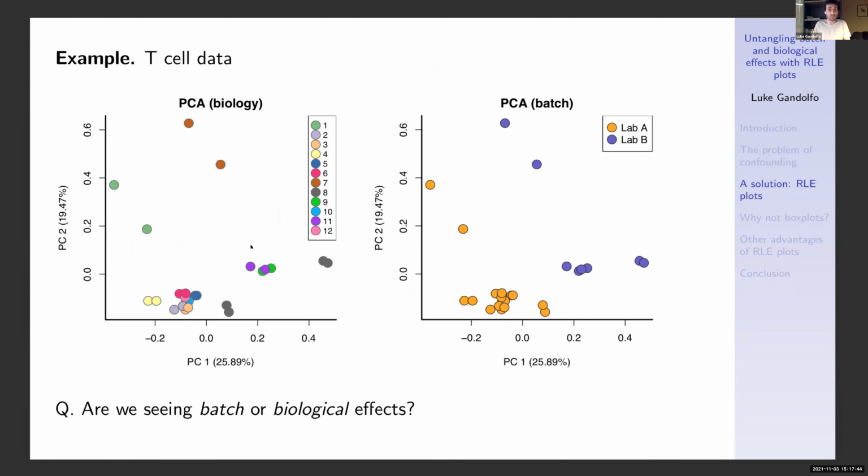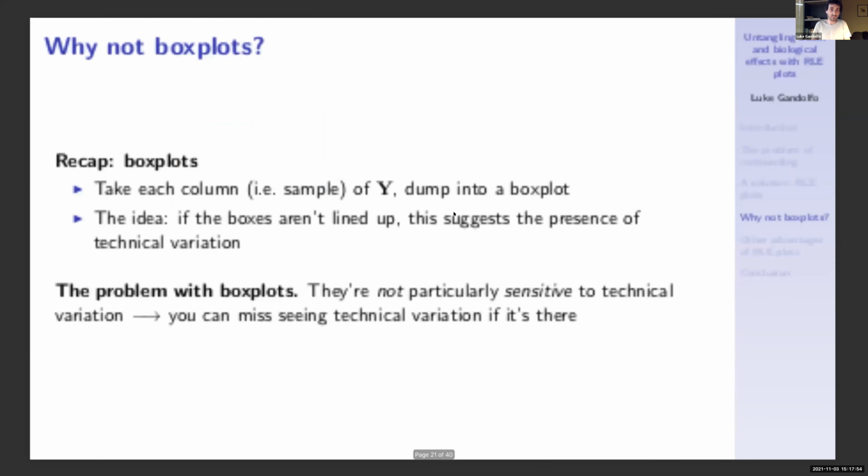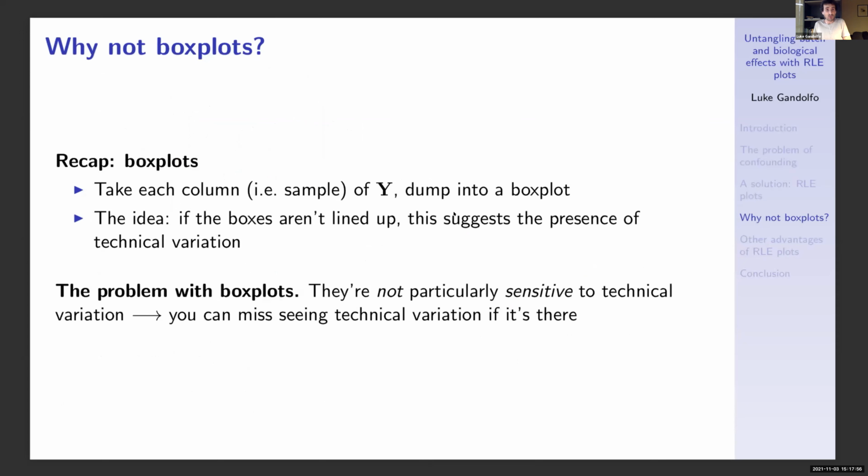Again, are we seeing batch or biological effects? Well, the RLE plot shows that we're seeing a serious batch effect. And again, we note the within batch variation. So at this point, you might be wondering, well, why don't we just use simple box plots, as some people typically do, which is to take each column of our data matrix and just dump it into a box plot. Of course, the idea being that if the boxes aren't lined up, this suggests the presence of technical variation.